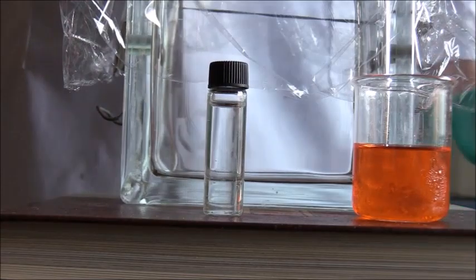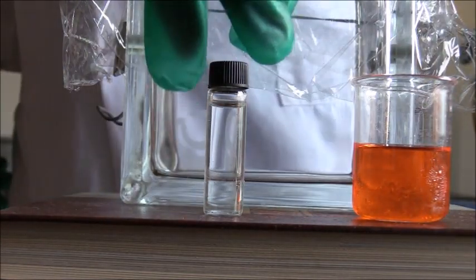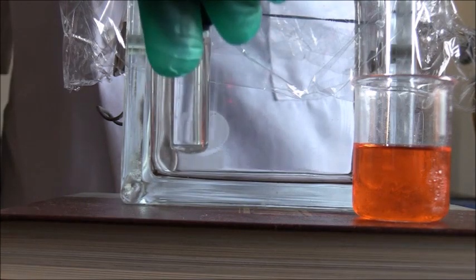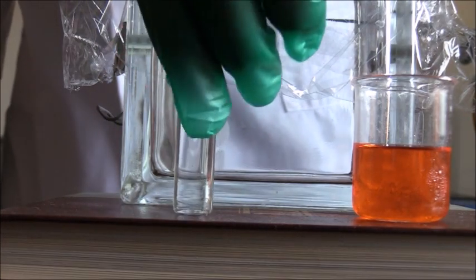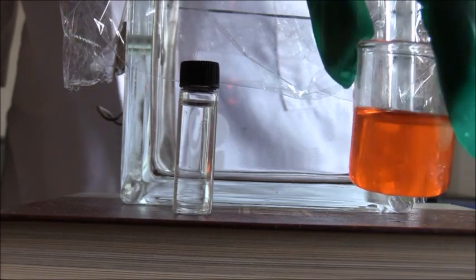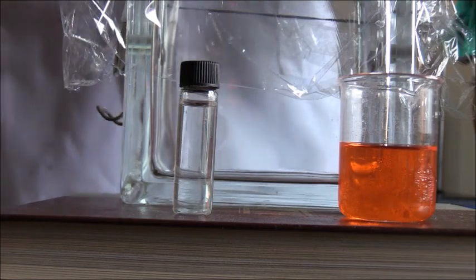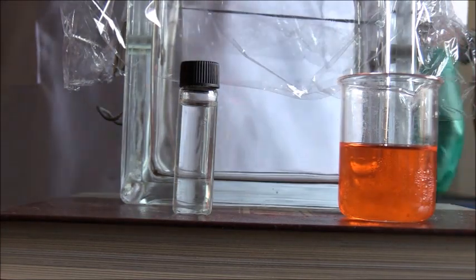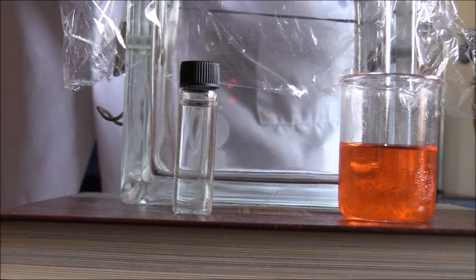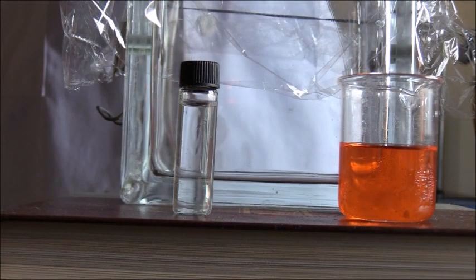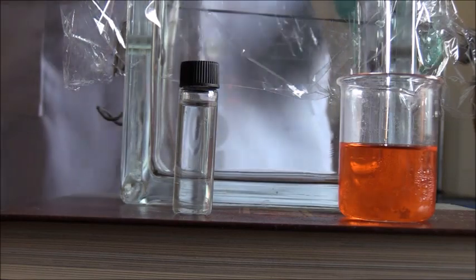Okay, YouTube, so here we are. We're going to do a thin layer chromatography now. This is our sample from the Miller-Urey experiment, my sample that I extracted. And this is our reference solution. It's a little bit orange, but that will clear out once we add it to our plate. And actually, I took the liberty of doing that step, and so this is the completed plate.